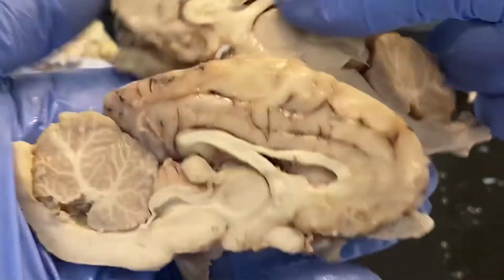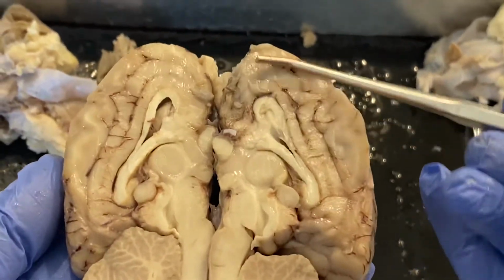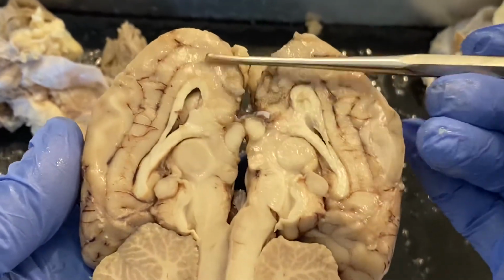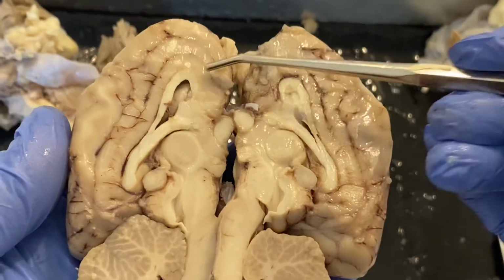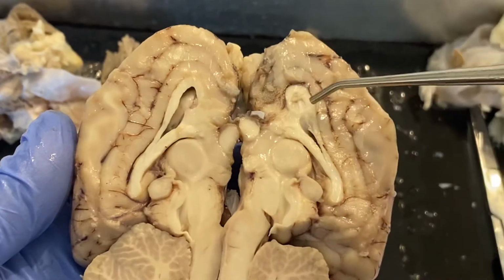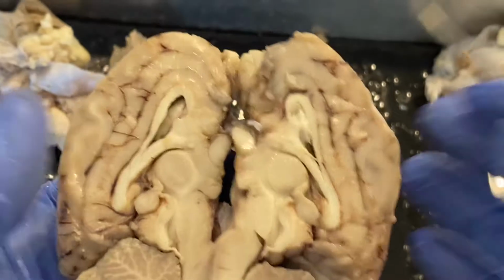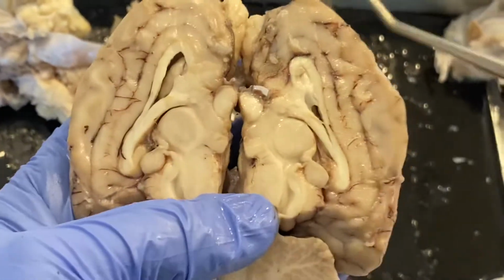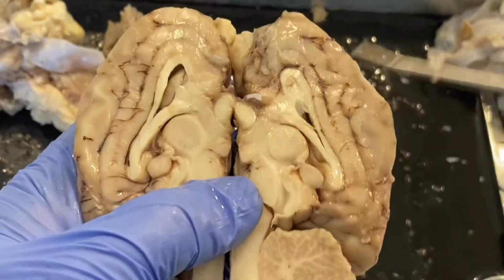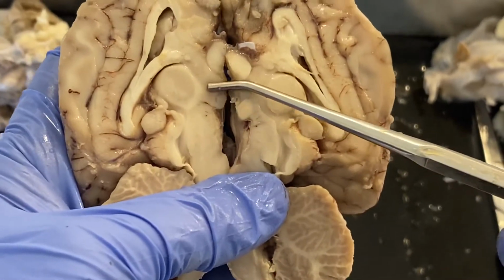And if you notice, you can look at the two halves of the brain. Again, starting from the rostral end, this is that olfactory bulb out here. We've got the corpus callosum on top. We have the fornix here. This is our lateral ventricle. And over here, you can actually see that septum pellucidum. The optic chiasm is kind of what we have right there. You can see that as we're looking at that there, which makes this region here the hypothalamus.